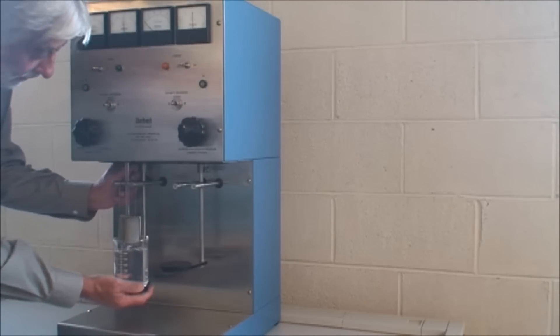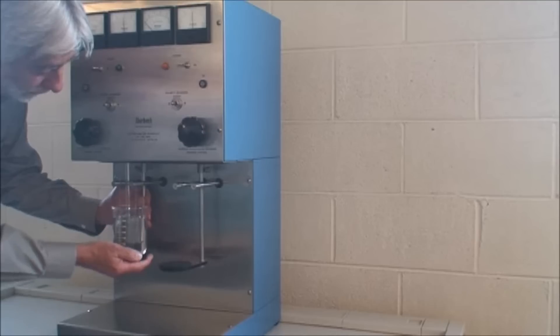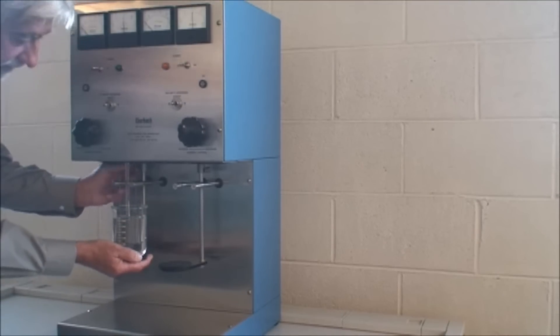To start the procedure, you would raise your sample over the electrodes and lock it.